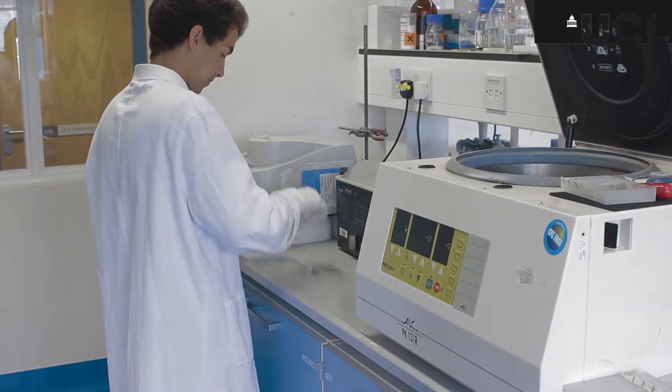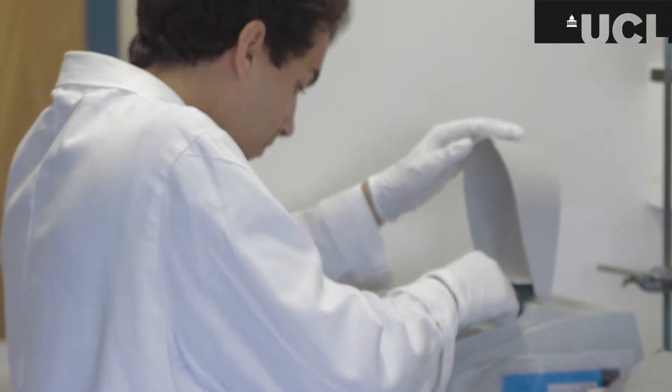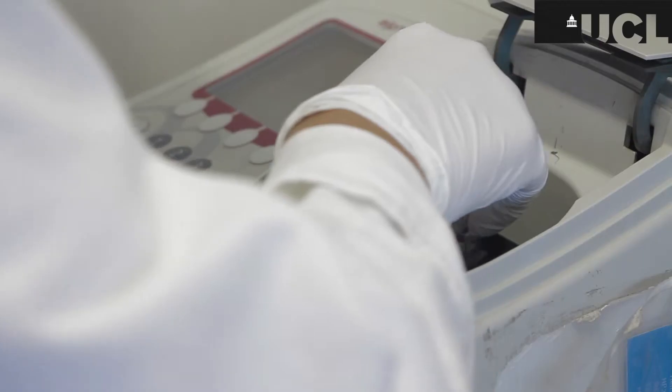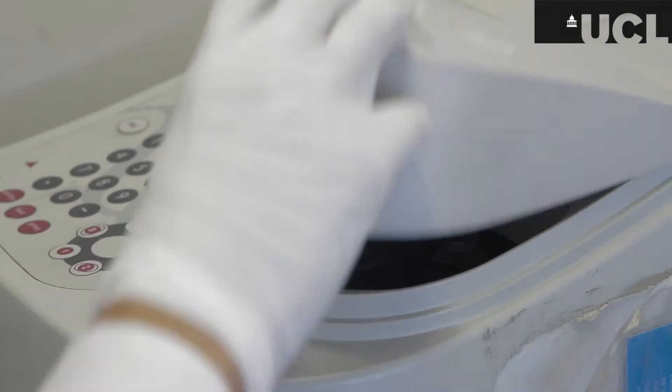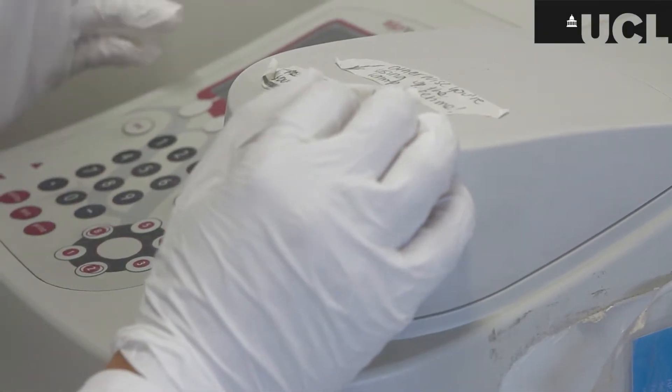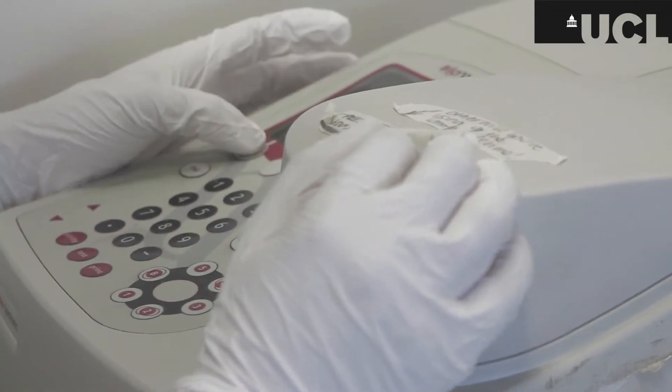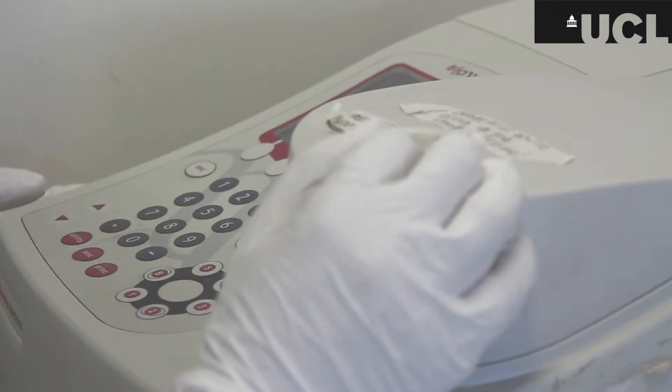Here this is the spectrophotometer and where I'm going to measure the optical densities. I'm being careful to put a blank in, that's just water here and that gives a baseline reading, making sure that the translucent side is in the right place for the measurement.